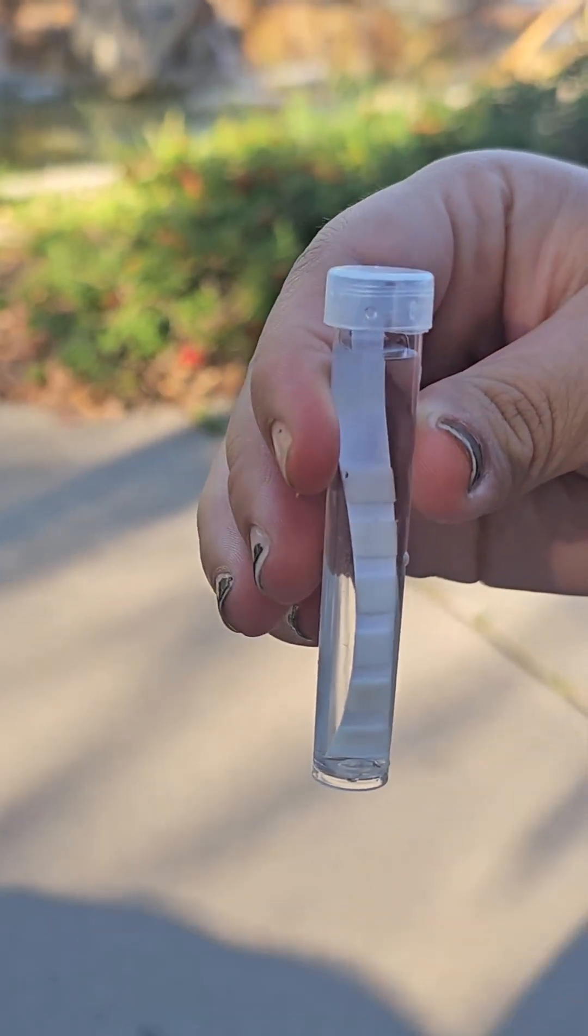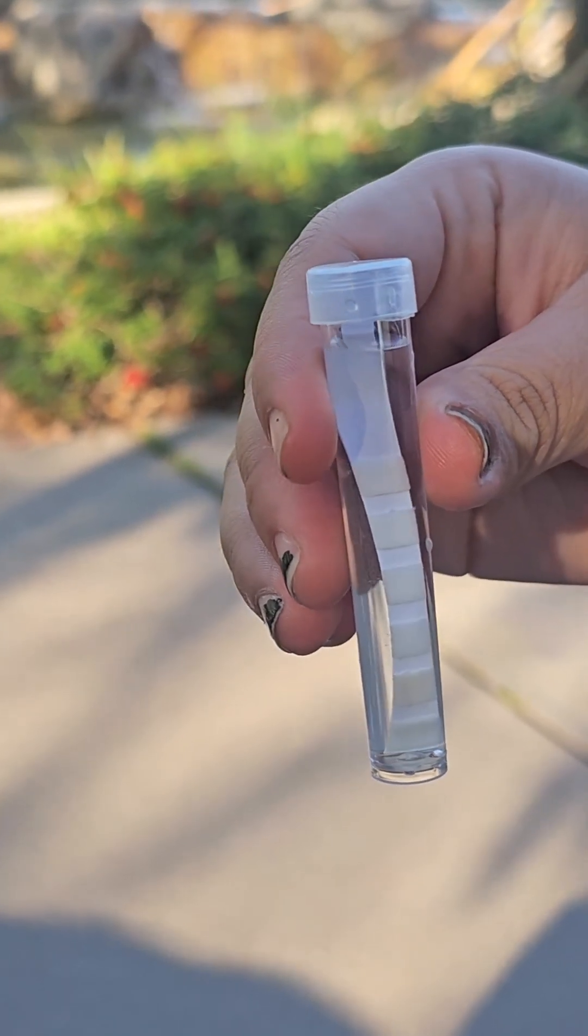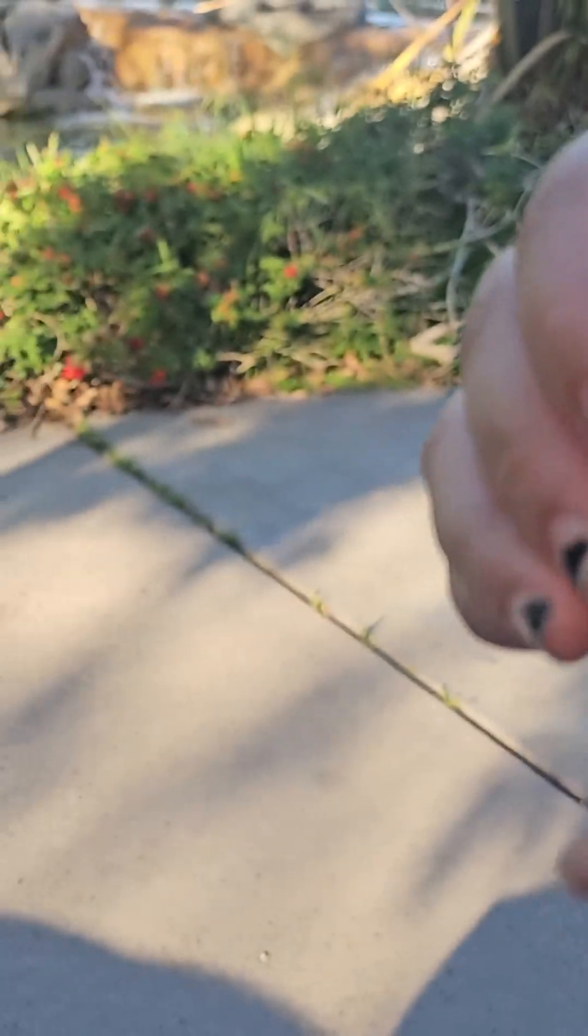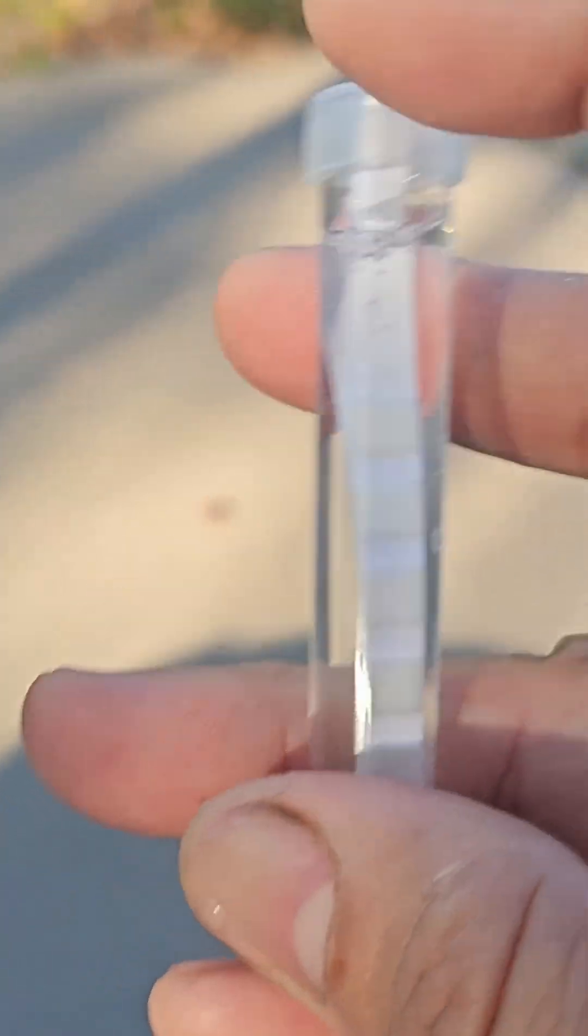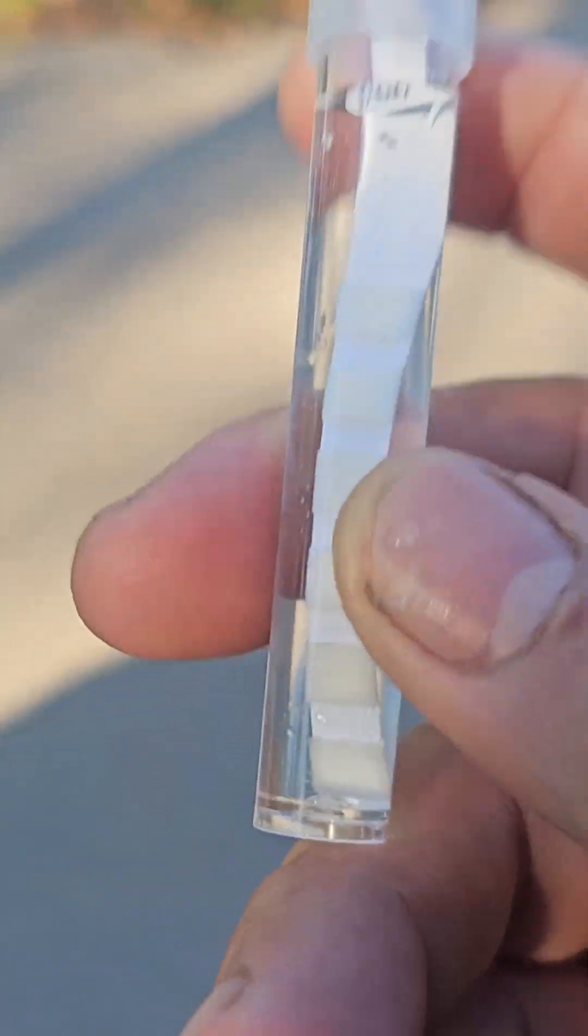You're going to have to leave it for about two minutes instead of 10 seconds. Recommendation is just to shake it around so you don't compromise it and it doesn't have any kind of dirt or anything. Shake it around.